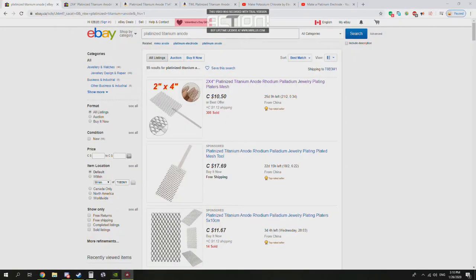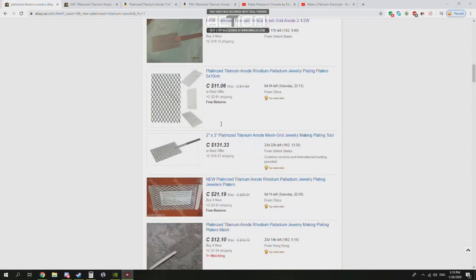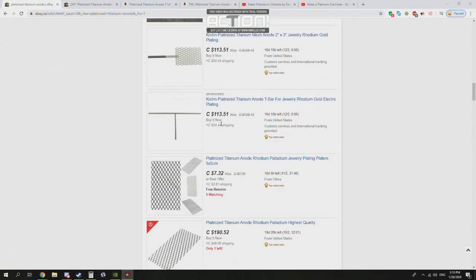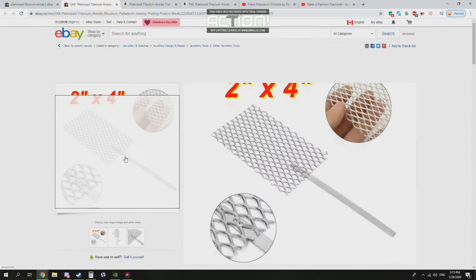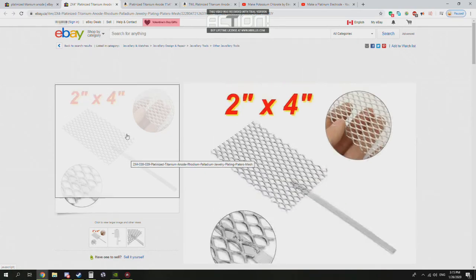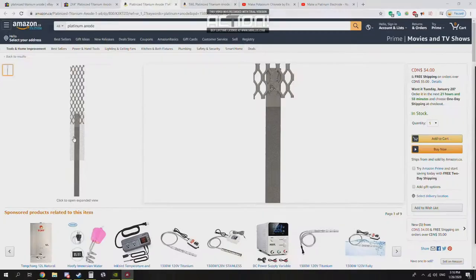So you can kind of see what I'm talking about here. All of these on here are fake for the most part. You can see they're all the exact same texture. They all look the exact same. They're all from these Chinese sellers. And yeah, they're all fake. So this one specifically on eBay apparently has over 300 sold. And you can tell it's just the exact same. It's most likely fake.